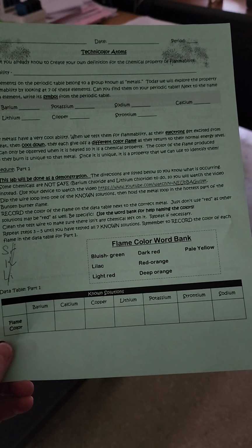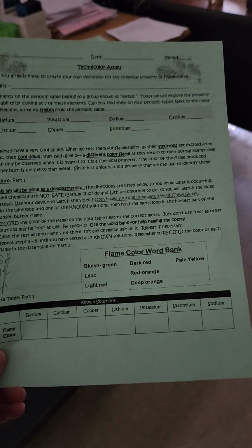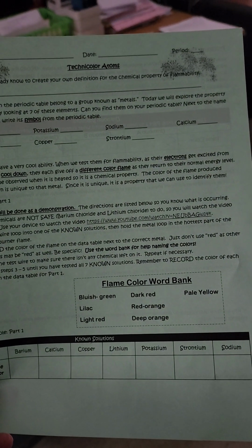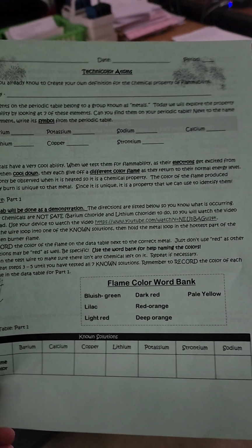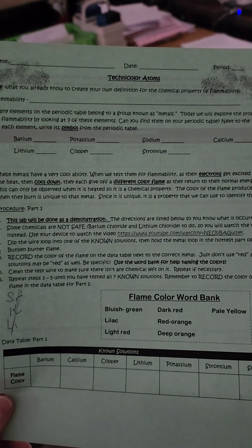Atoms, when they get excited or heated, their kinetic energy, as we know, increases. And so as they cool down, they will start to give off a packet of light, which is called a photon, and they emit light. And so we are going to see what the different colors are that these atoms give off.